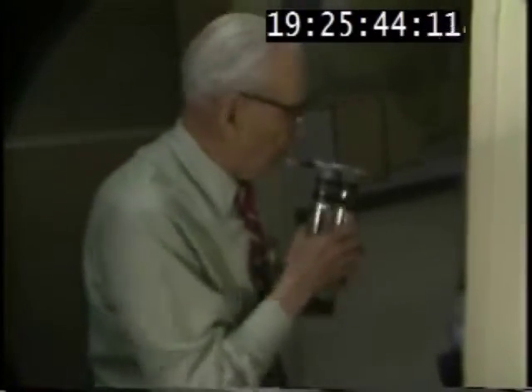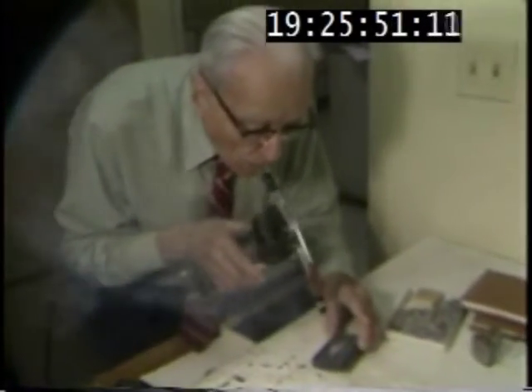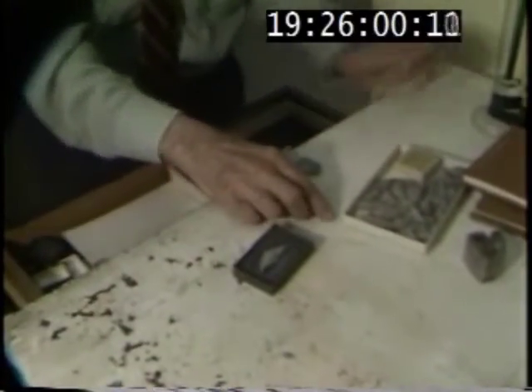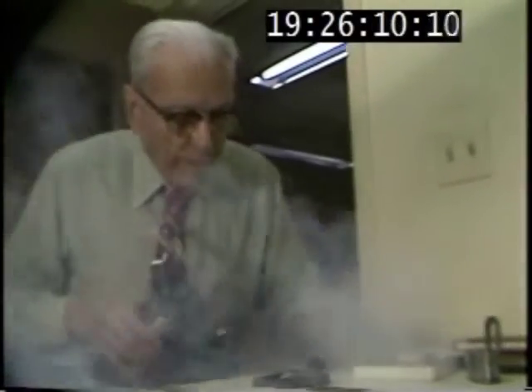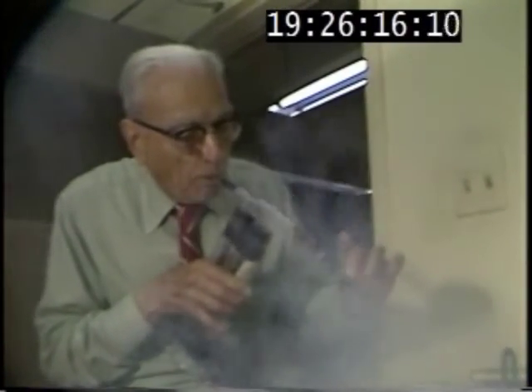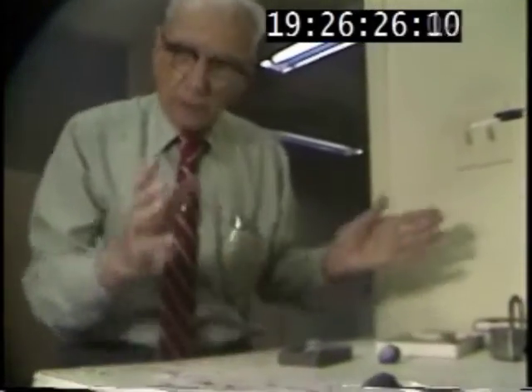It's what's known as dust grade. The specimen is coated with the dust of ammonium chloride. You can see here, we sometimes use black specimens. It makes it very like a wash drawing.